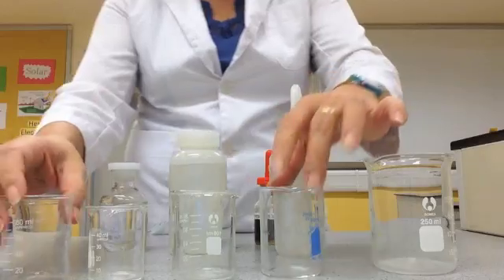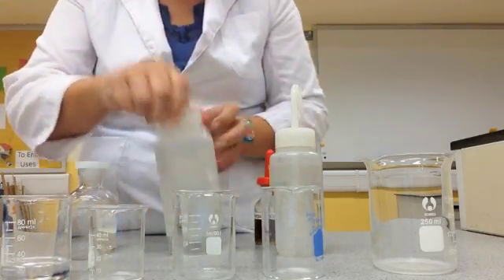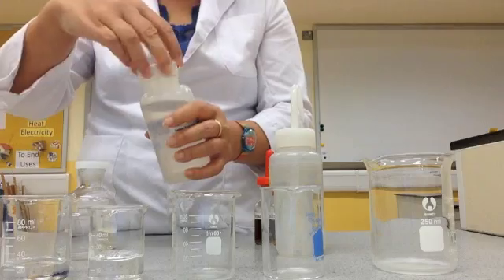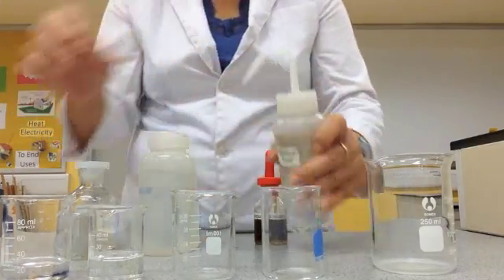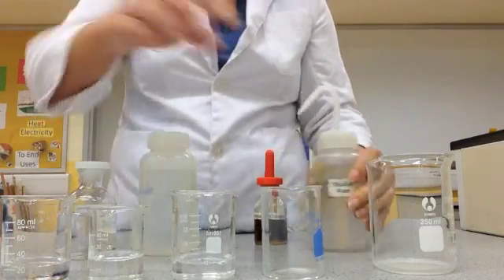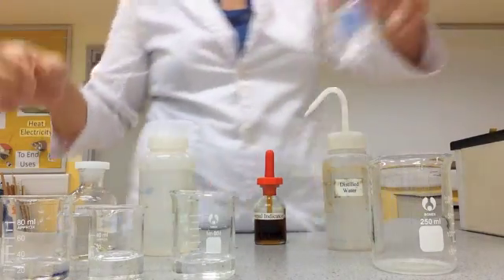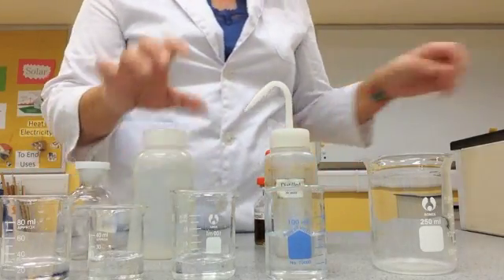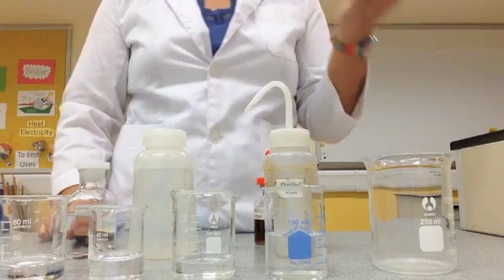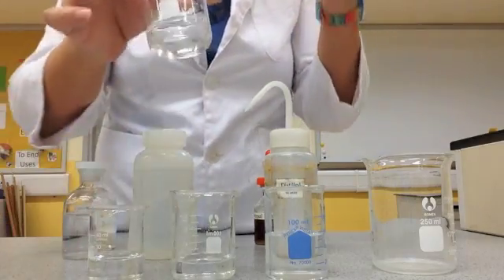What I have here are different kinds of substances. I'm going to put some of these over here, and some over here, and also tap water. By using our indicators, we should be able to tell whether each one is an acid, alkaline, or neutral.